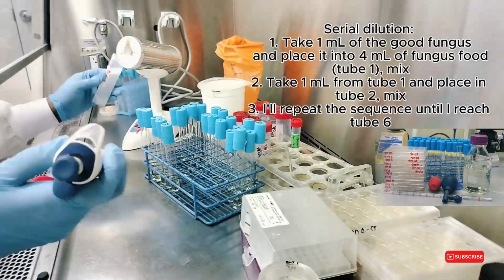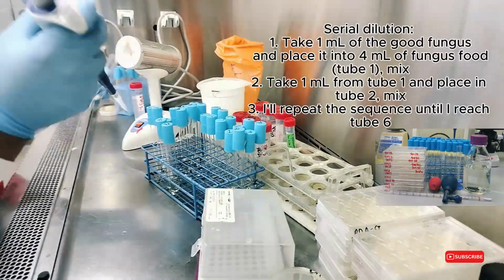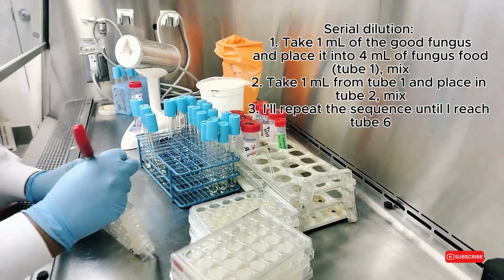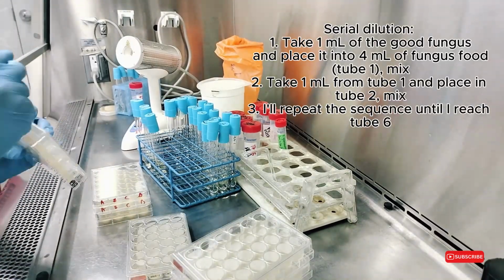Serial dilution. 1. Take 1 milliliter of the good fungus and place it into 4 milliliters of fungus food. Tube 1, mix. 2. Take 1 milliliter from tube 1 and place in tube 2, mix. 3. I'll repeat the sequence until I reach tube 6.